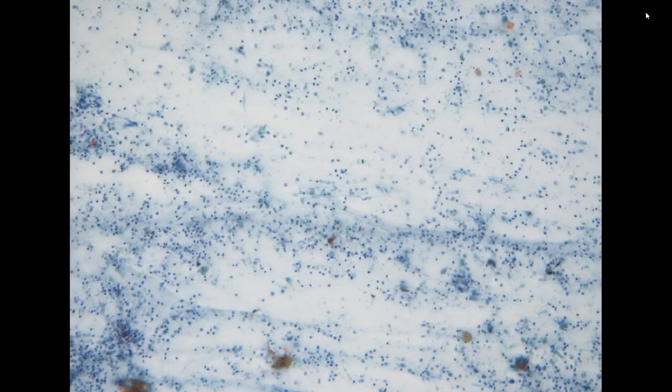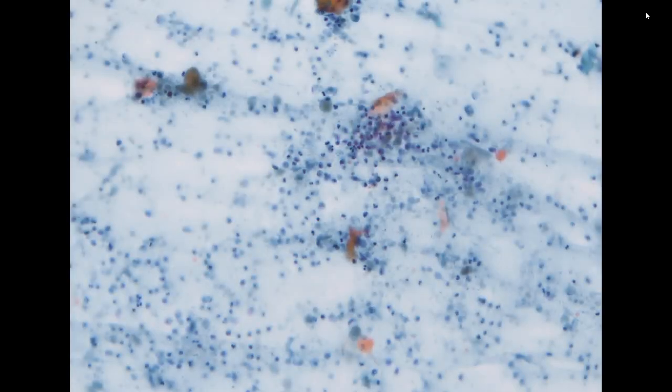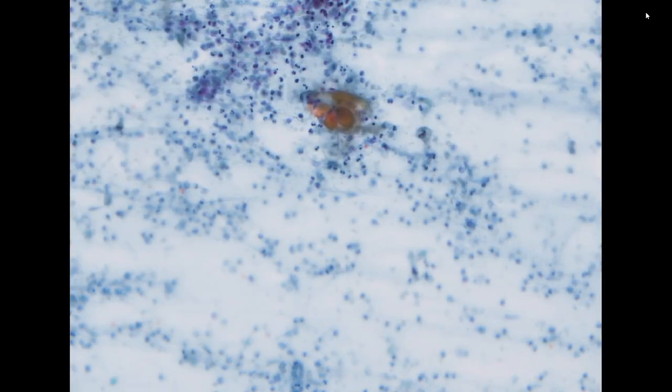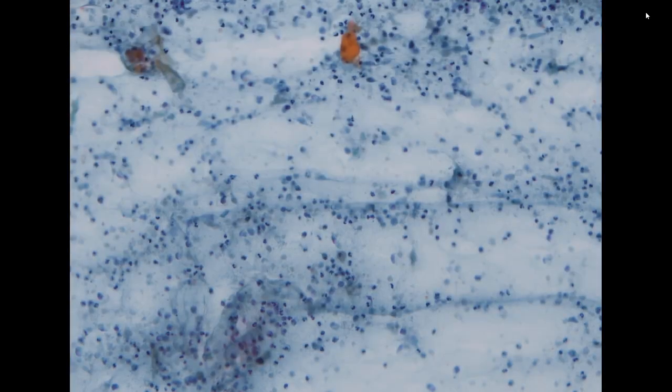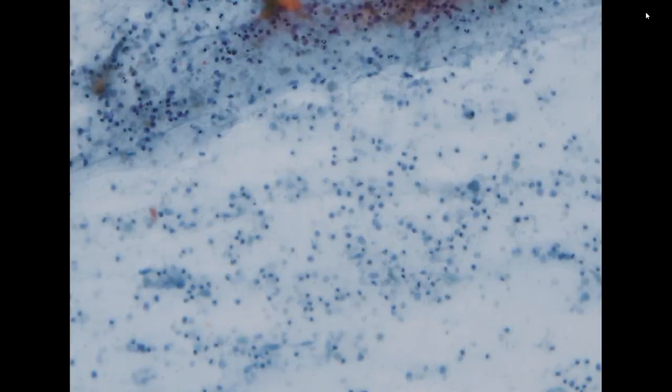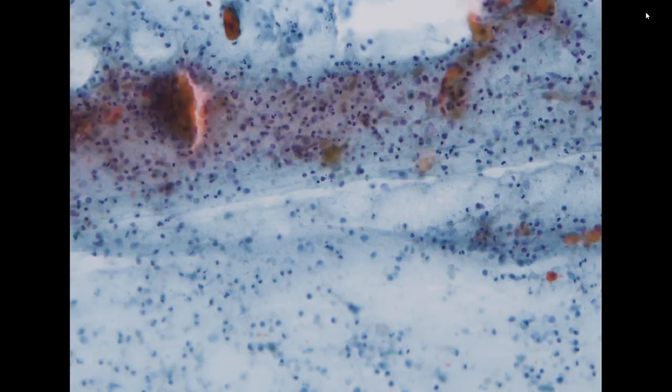So you have 3 consecutive specimens. 2 were the fluid specimen for cytospin. There is 1 direct aspiration and smear, which looks like these. Again, the background is highly inflammatory, and it shows a lot of debris. And we see scattered keratinized cells, some with nuclei, some without. But the keratinization itself is a very strange finding, because usually it won't present in a cystic lesion.